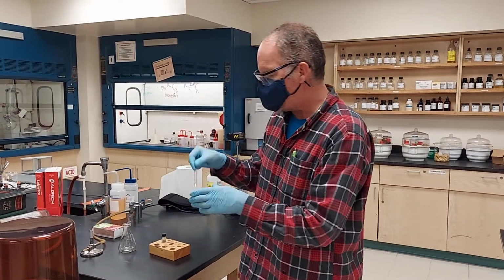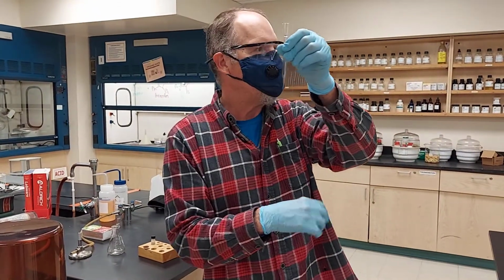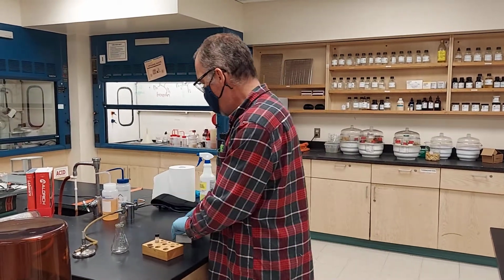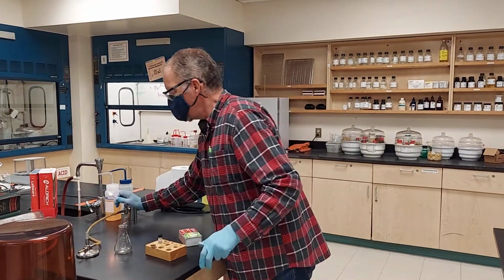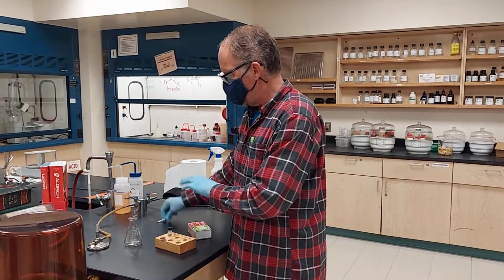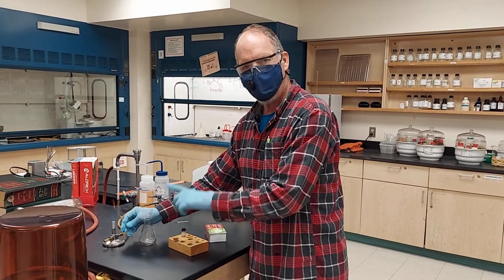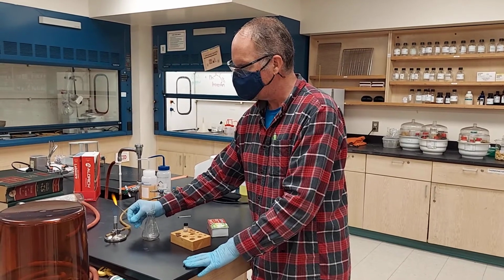Right now, I'm going to make a capillary out of the bottom of a pipette, a melting point capillary. I just need to seal the bottom of the pipette. So we're going to seal it. We keep it vertical so that moisture from the combustion reaction doesn't enter the capillary before it's sealed.